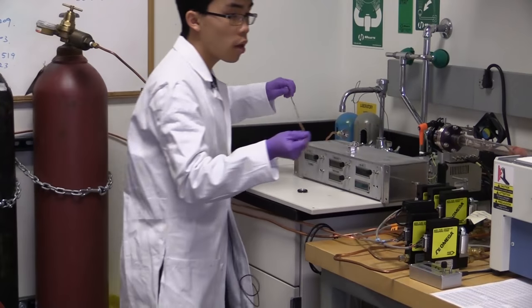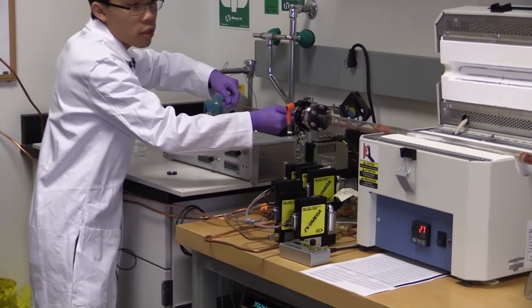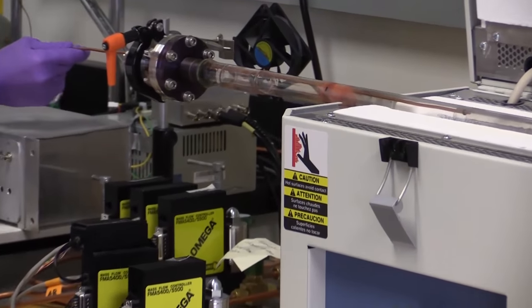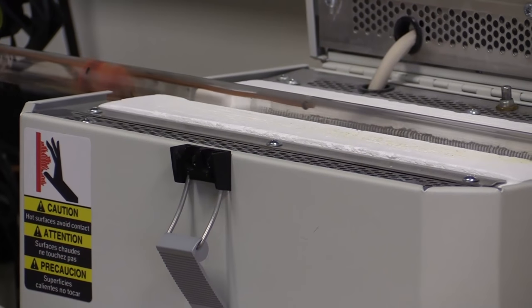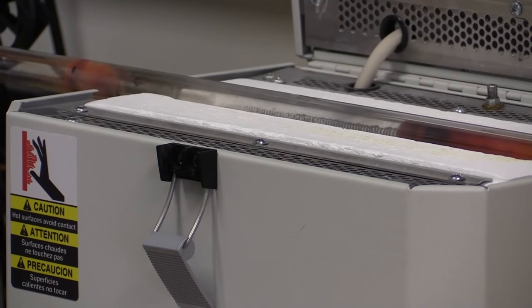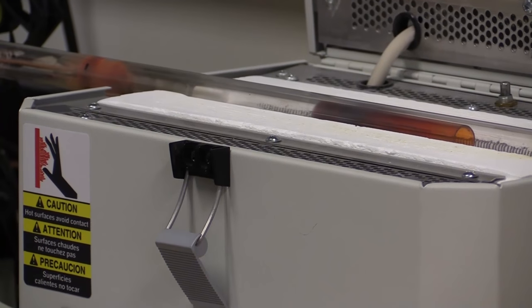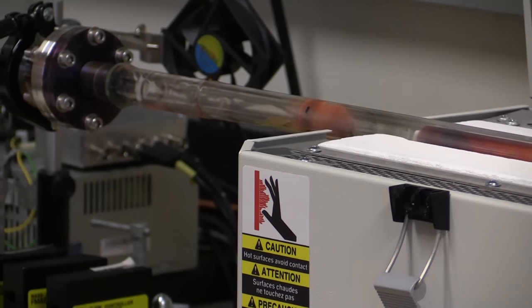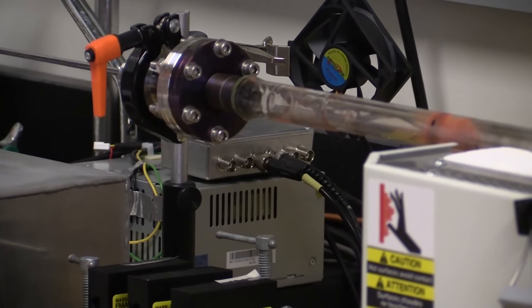And using this rod, I'll just pull the substrate tube out. There we go. Sometimes it doesn't want to go. Excellent. Switching to forceps. Guide it out.